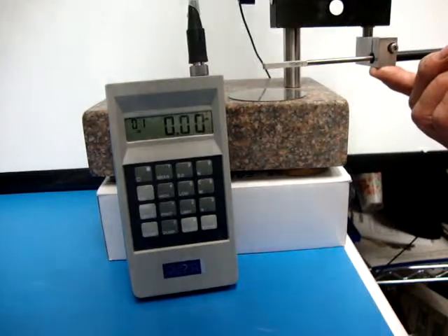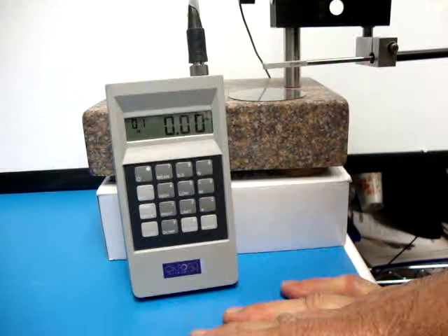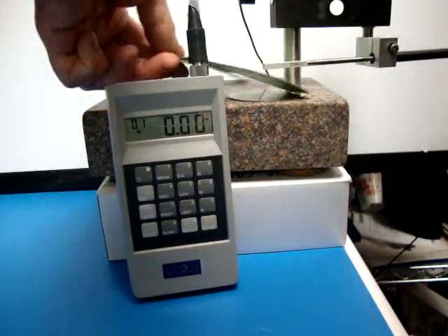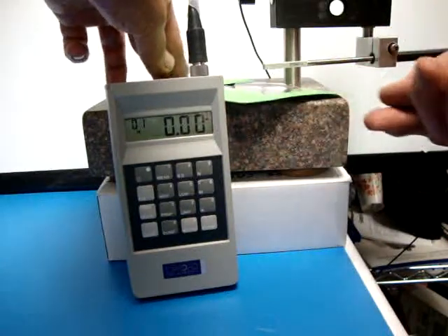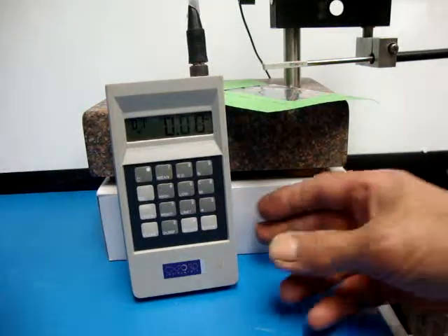So then I'm going to hold the probe up above the base again, and I'll grab my first shim, which in this case will be a 0.2. Not much room for that, but okay.